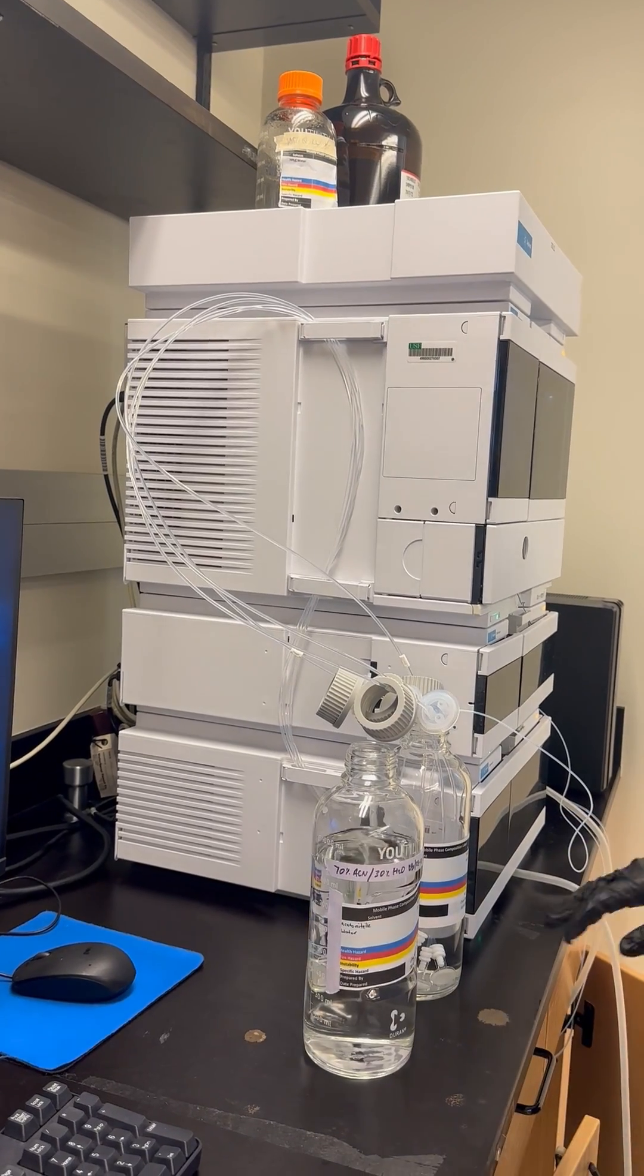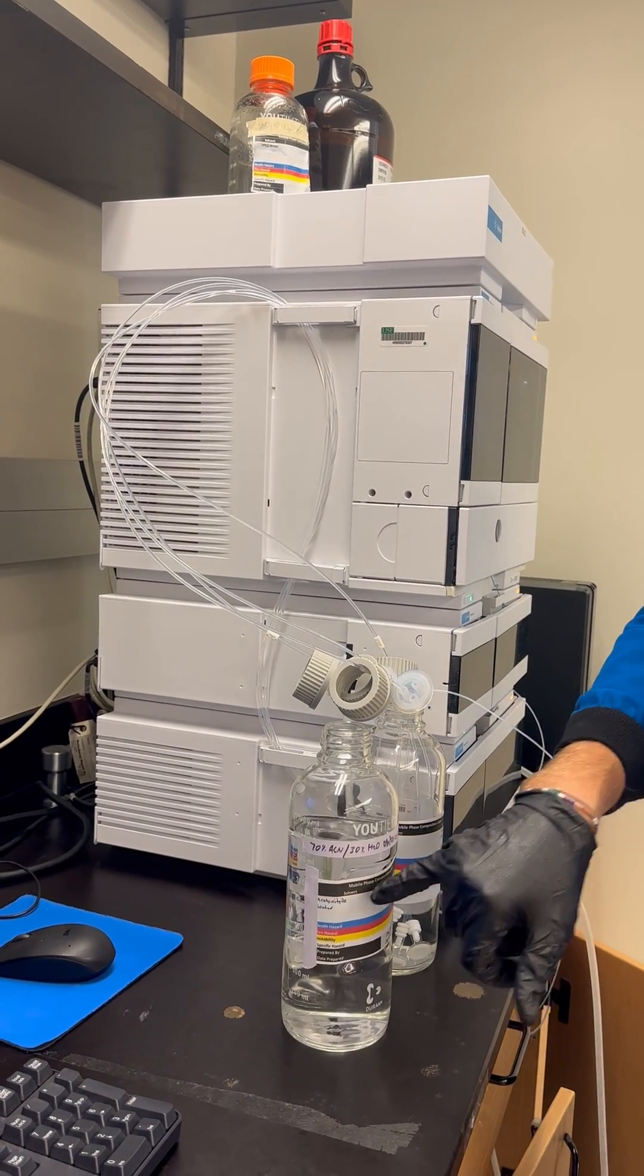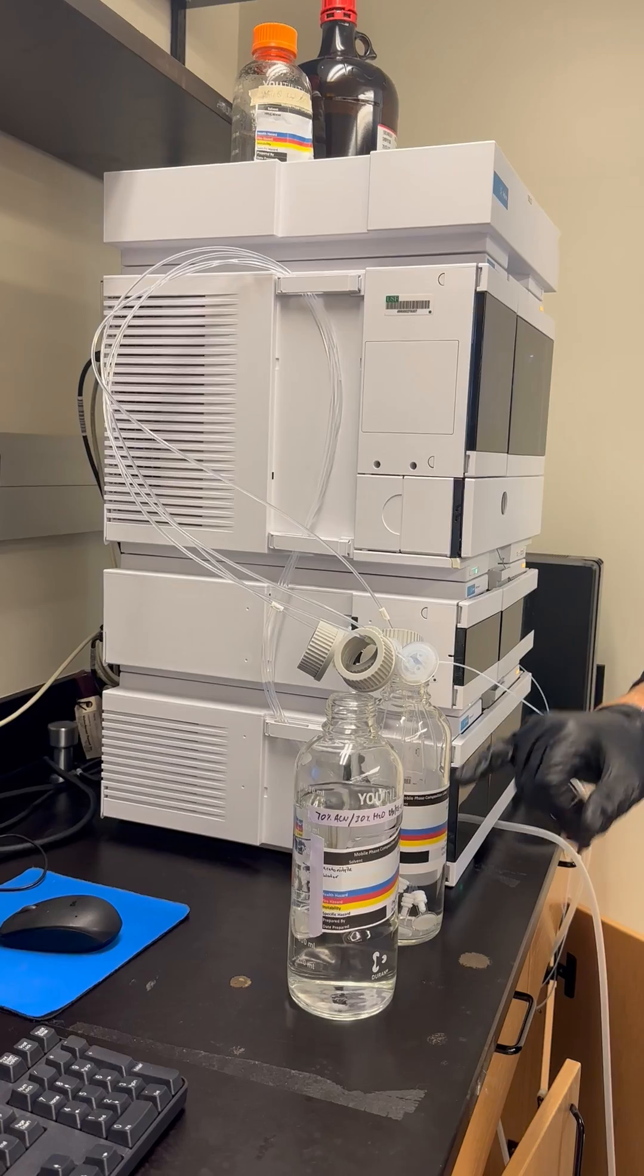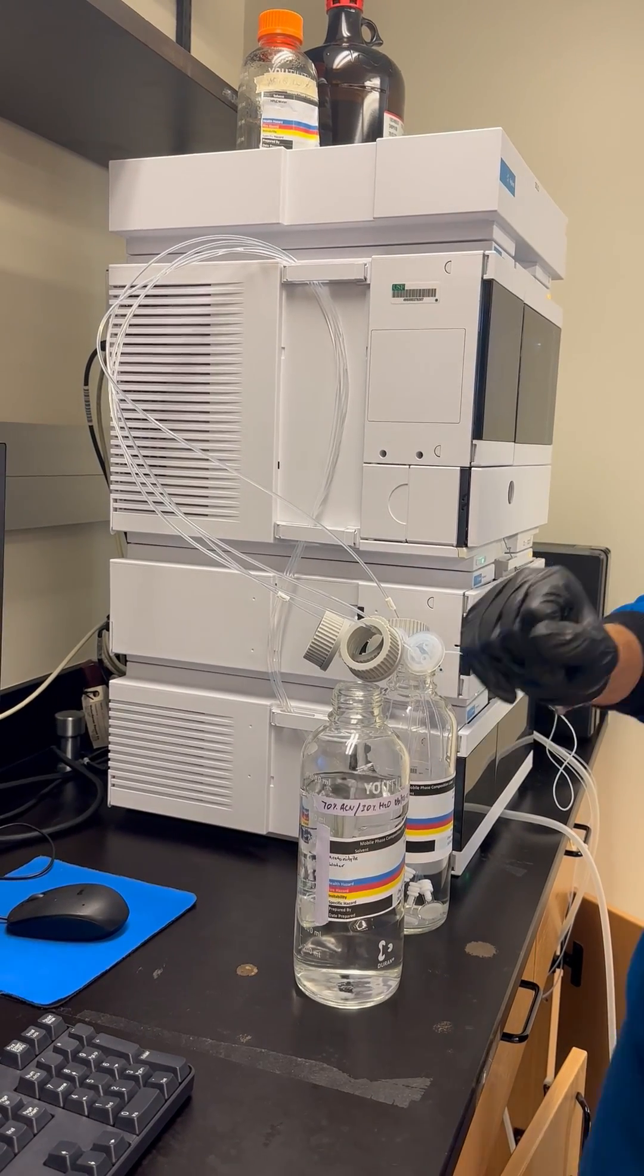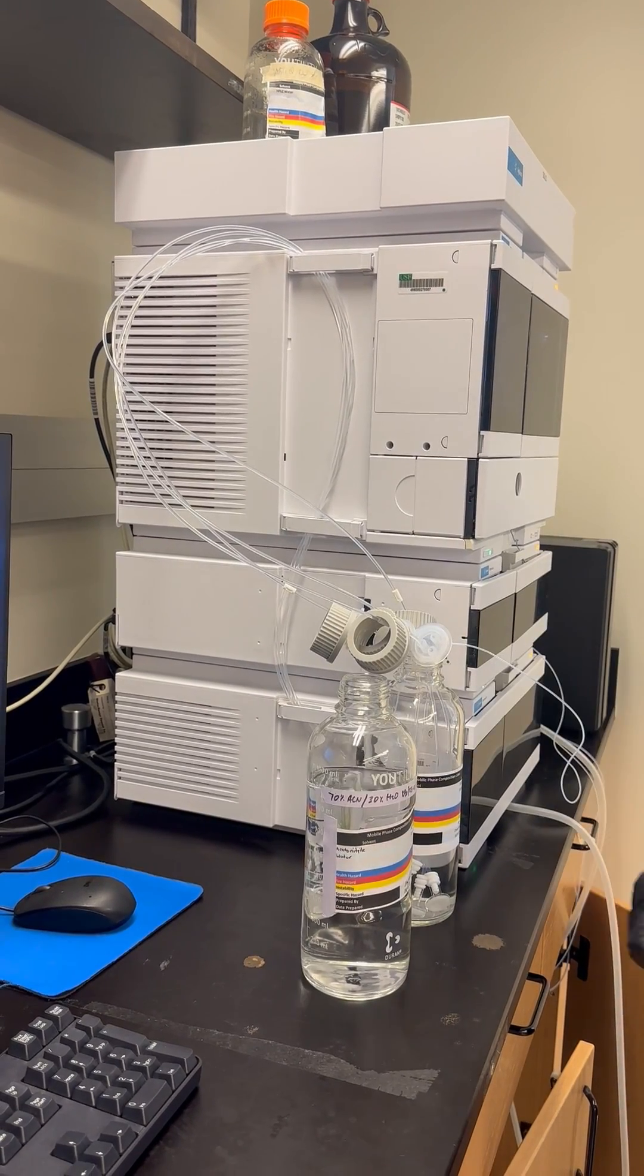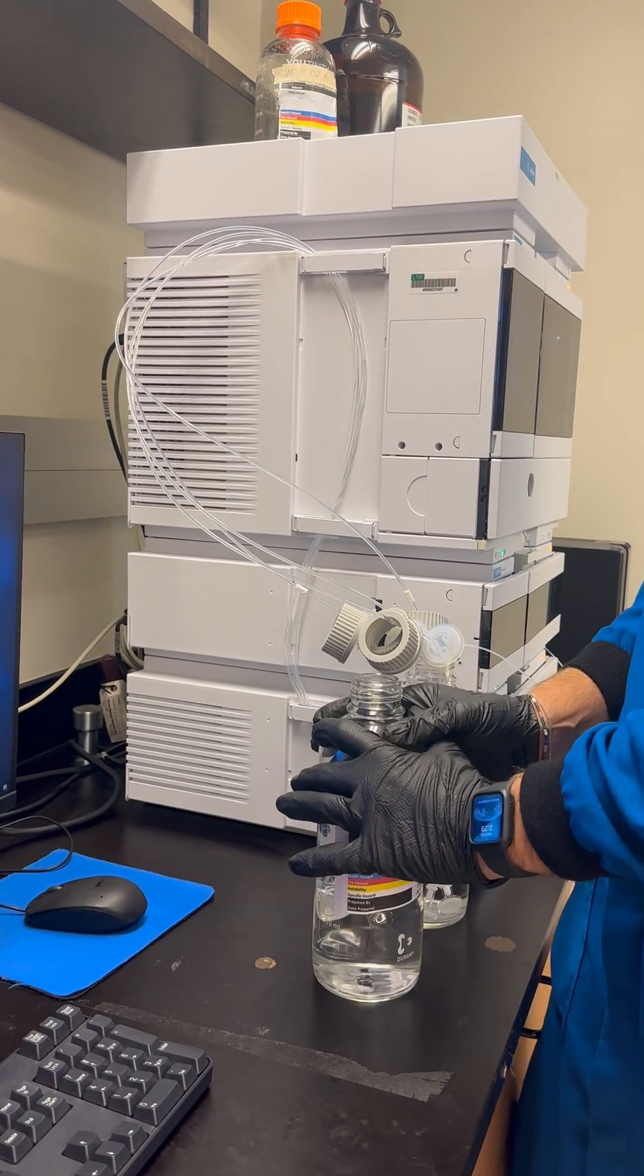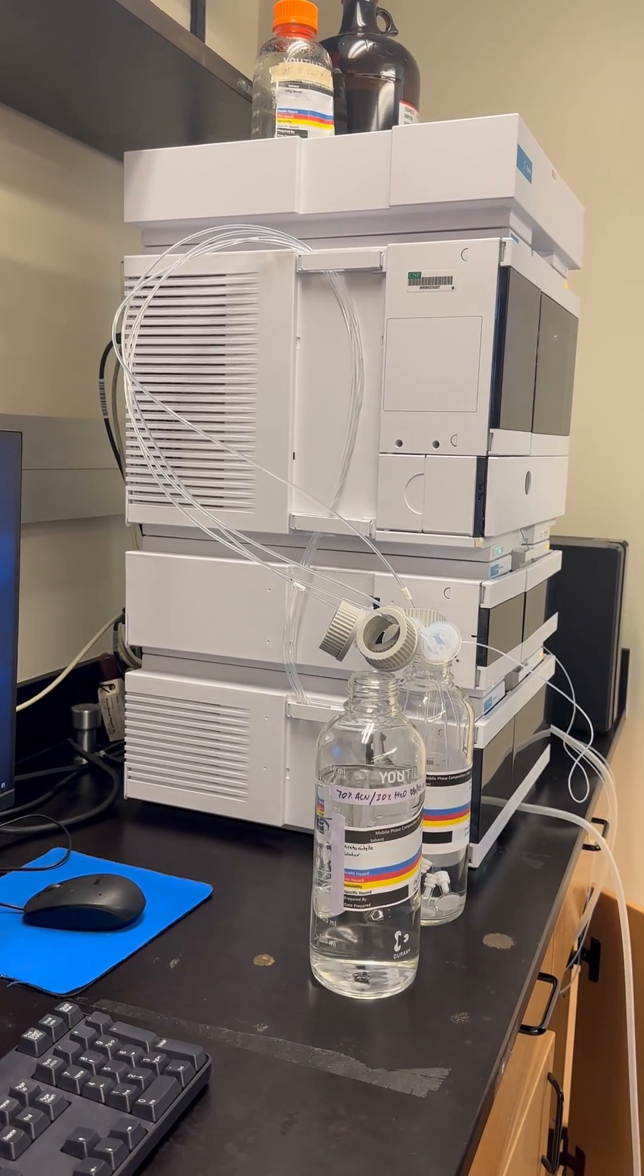So remember, if you're going to be using, let's say we only want to use this one component and we want to pull 100% of it through line A. We have four lines: A, B, C, and D. We can't just put line A in here and expect no issues.